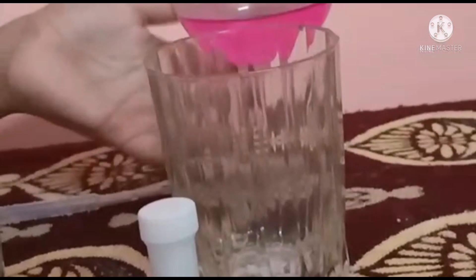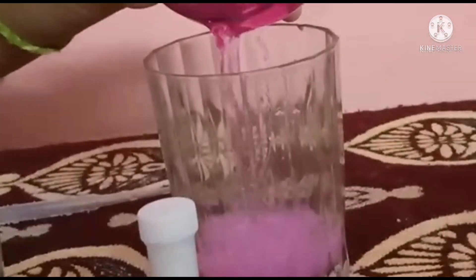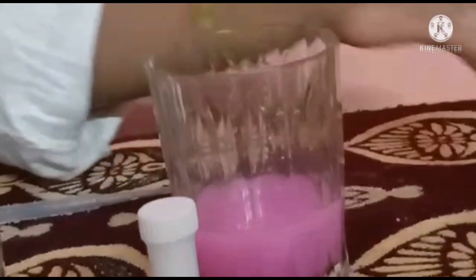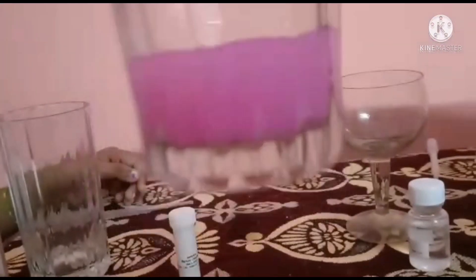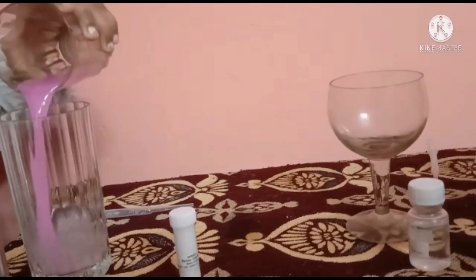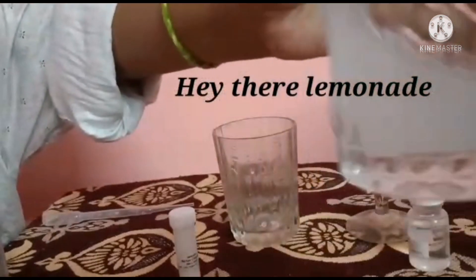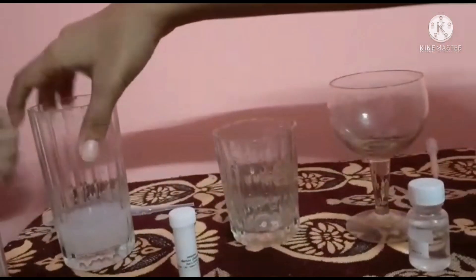Did you see that? Look at that color change! It looks like champagne or something. Now we are making a milkshake. Look at the consistency and the light color change that happened there. It really looks like strawberry milkshake, doesn't it? Next is juice — lemonade. Woah, just look at that! It just lost its color! Hey there, lemonade! Guys, it's not safe to drink, so please use caution.